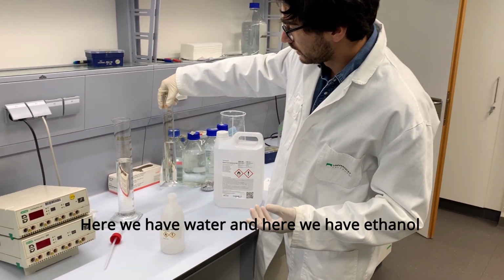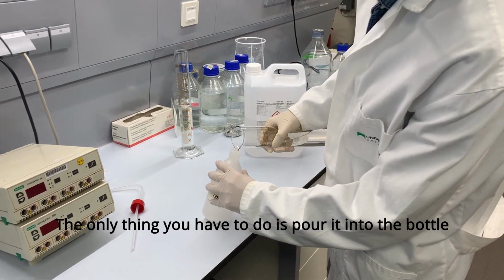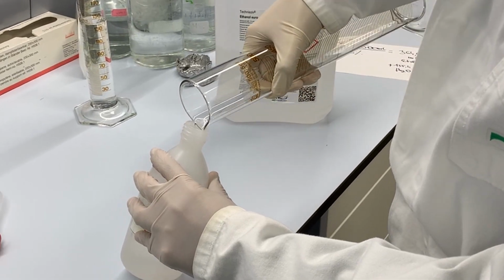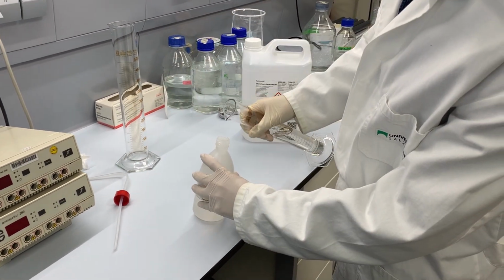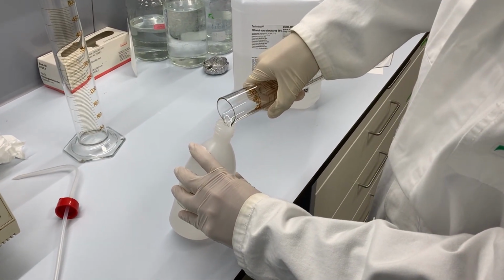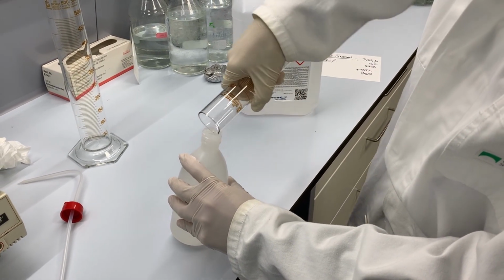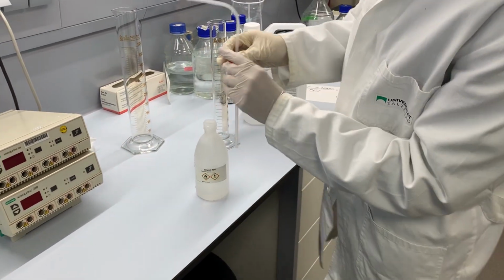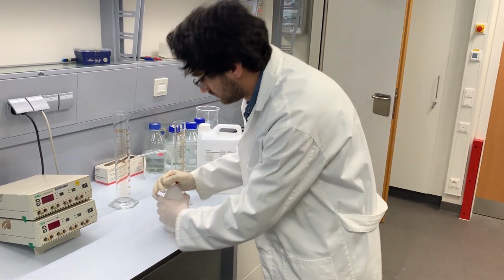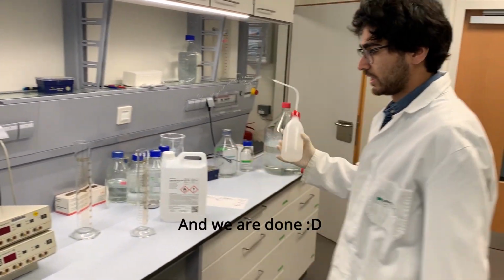So here we have the water and here we have the ethanol. The only thing you have to do is pour it into the bottle. The water. Close it. Shake it a little bit. And we are done.